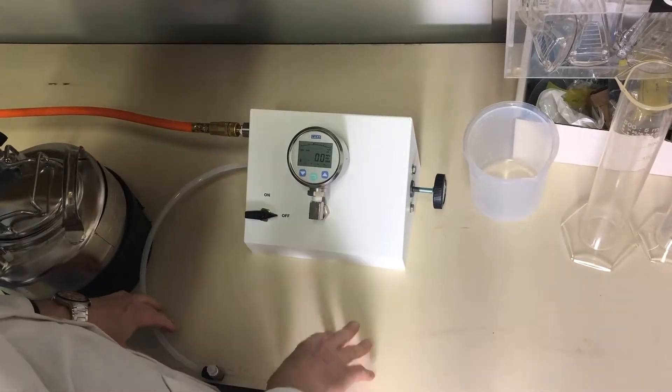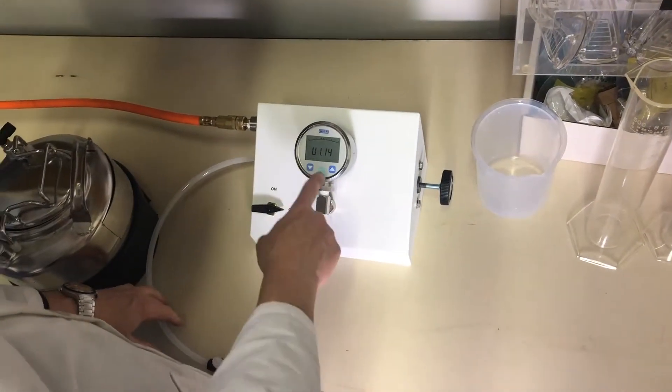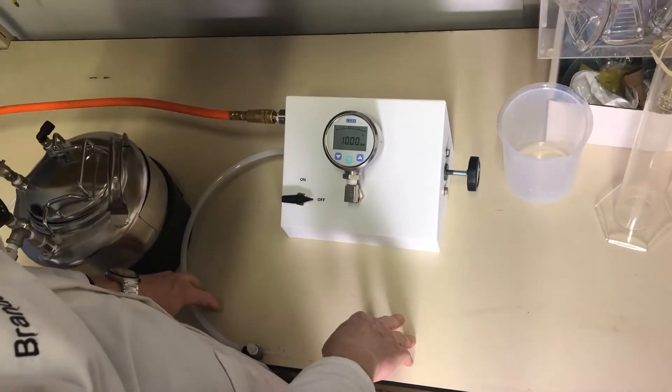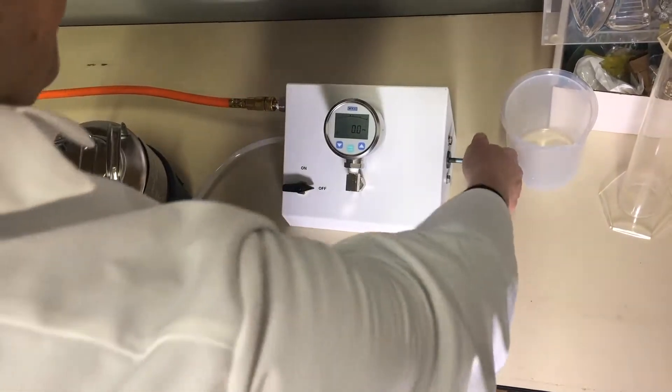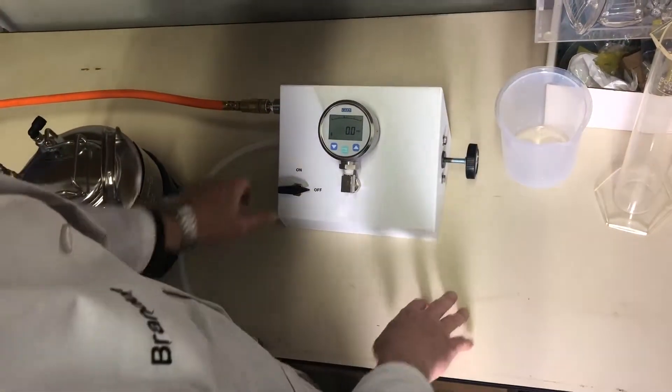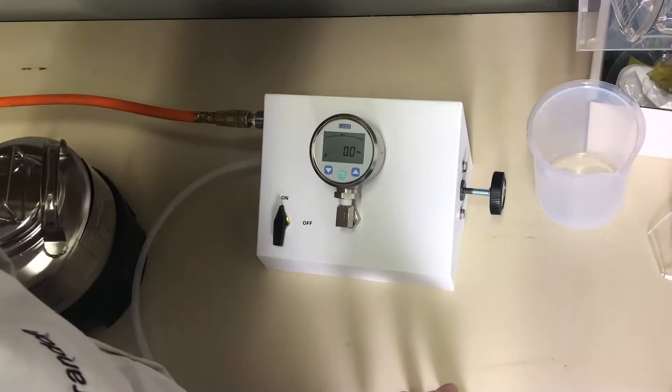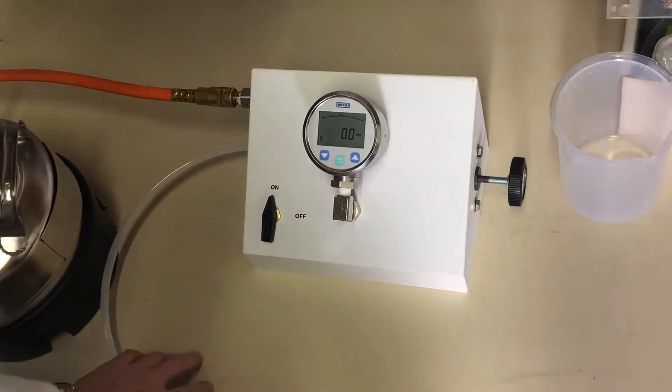Next step, turn on gauge, make sure it's reading zero. Check to make sure that's out, go ahead and turn it on.